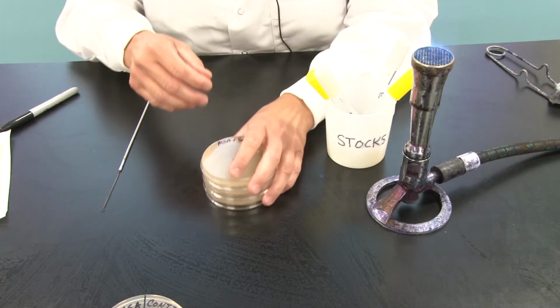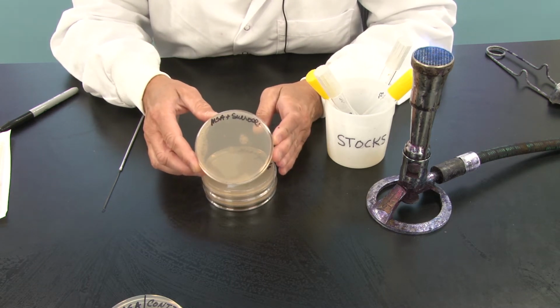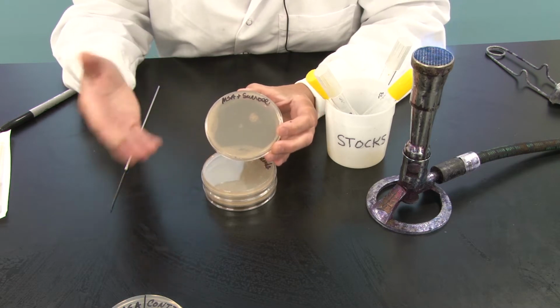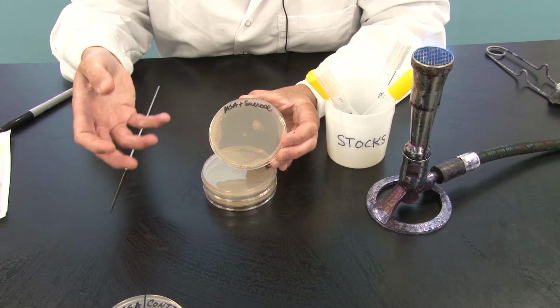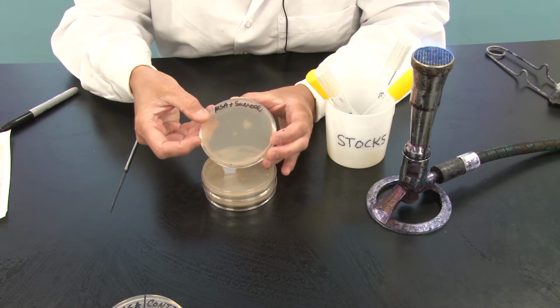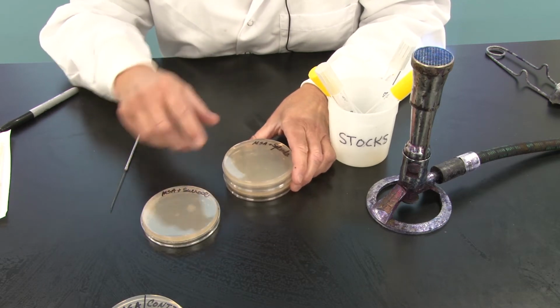But let's take a look at our other 3 carbon source plates. We have one that was minimal salts agar that we added sucrose to. Minimal salts agar, you will recall, was a defined medium. Once I added an unknown quantity and unknown purity of sucrose, it became a chemically undefined medium. So I'm going to inoculate that.